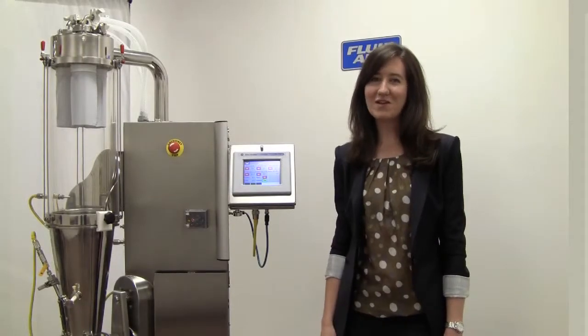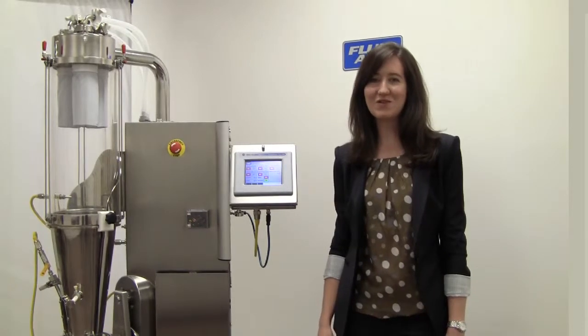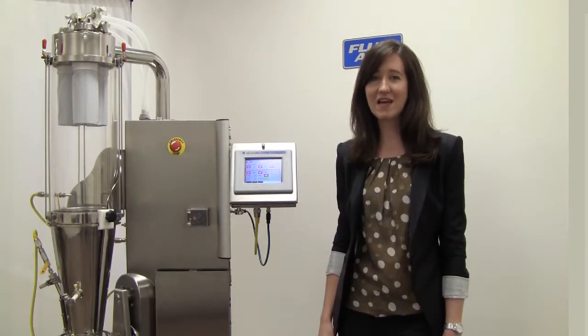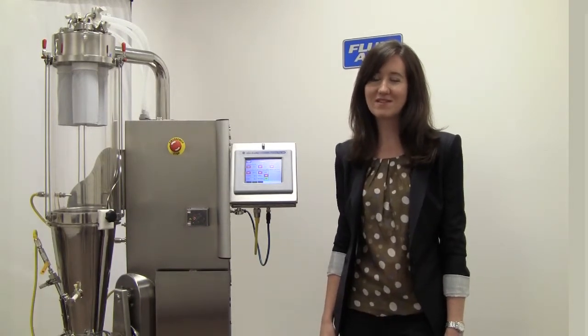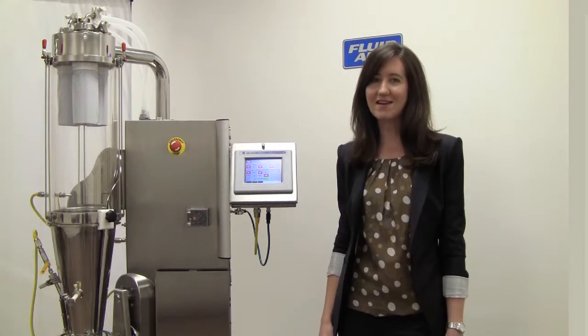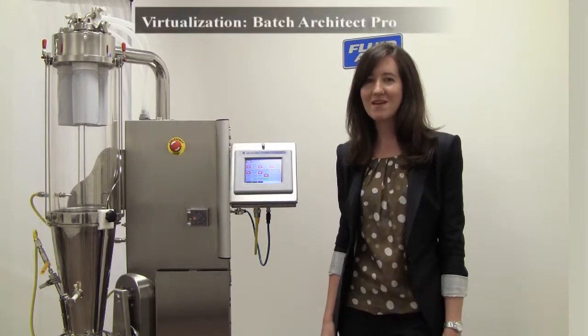Fluid Air can replace the control system on nearly any type of batch processed equipment with either our Batch Architect or Batch Architect Pro system.